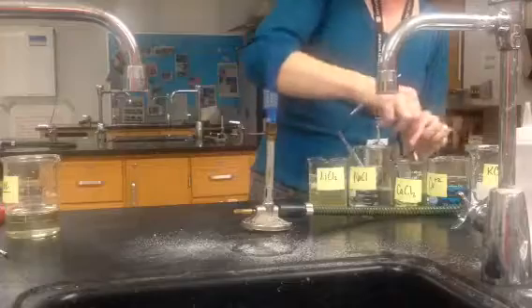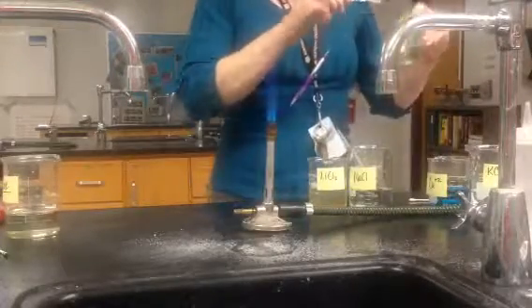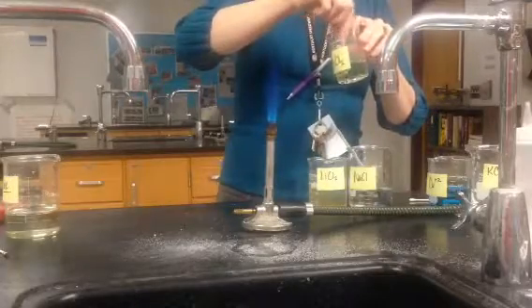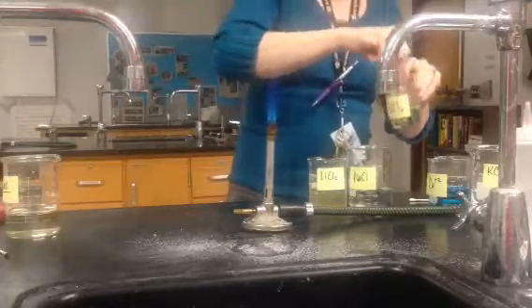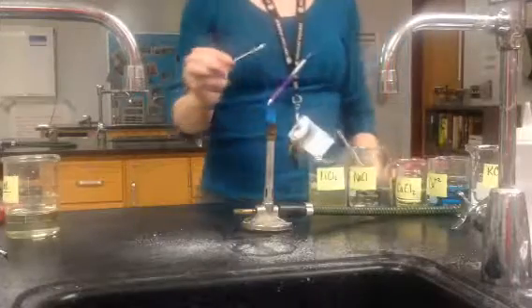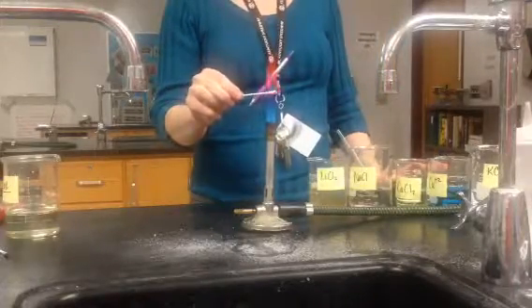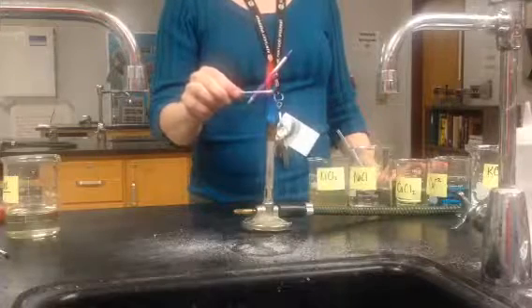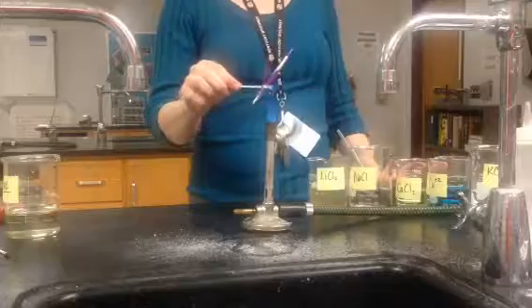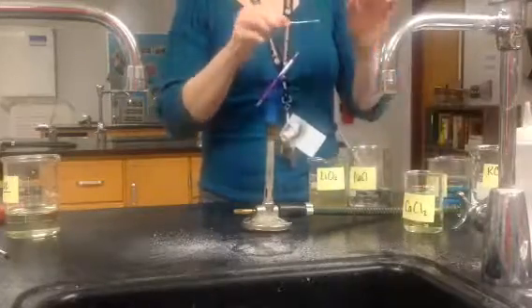The next one is calcium chloride. This is our next potential solution that might tell us what our unknown was. Now, that is an orange red. What was our unknown? It was an orange red too. So let's pull this one to the front and keep that in mind.